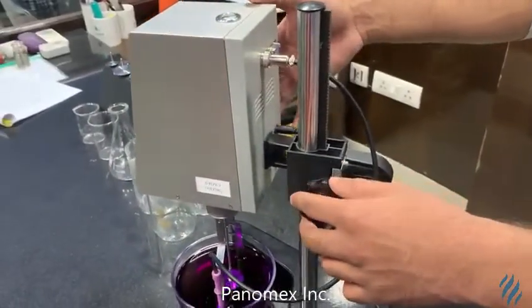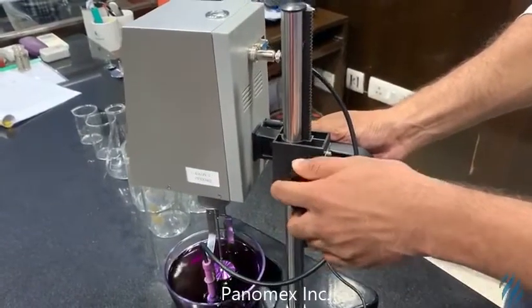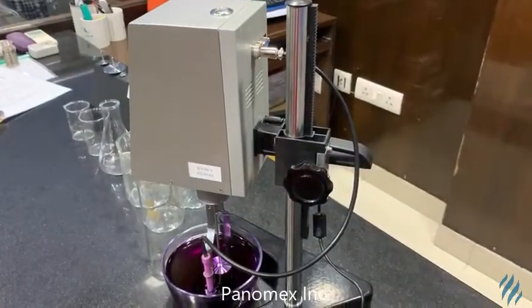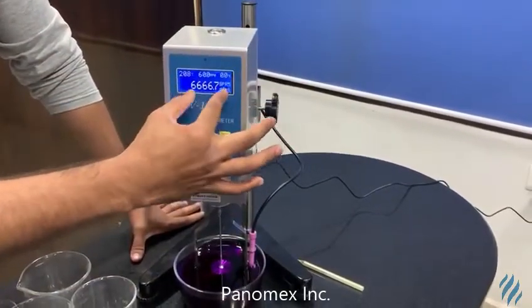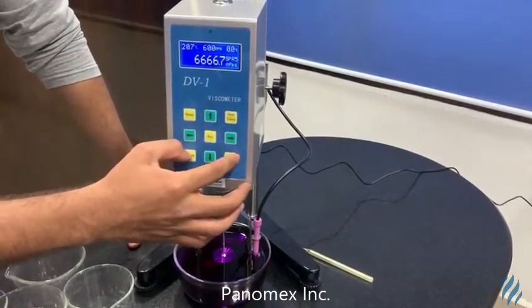You can also adjust this machine through this knob. Now, that's how your screen looks — these are the various options which are available here.